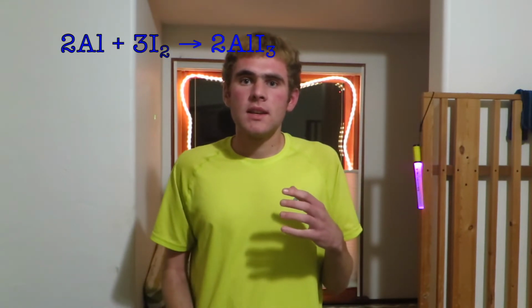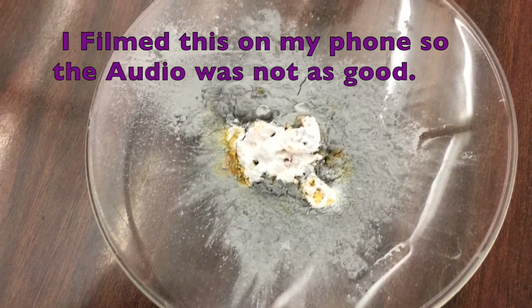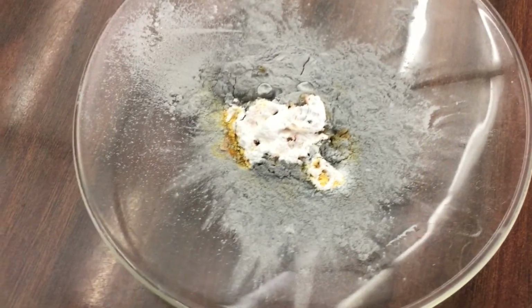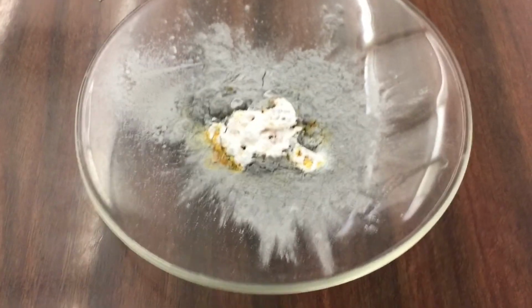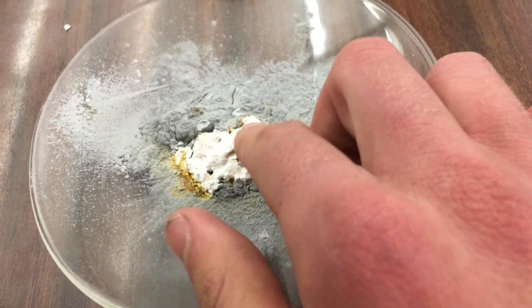The second thing this can be used to demonstrate is redox reactions, because the aluminum is losing electrons to the iodine, and it is forming the compound AlI3, which is aluminum iodide, and it is a white crystal that we saw when we cleaned off the evaporation dish. So this is what our product looks like. It is AlI3. Yeah, basically something white and it's pretty flaky.